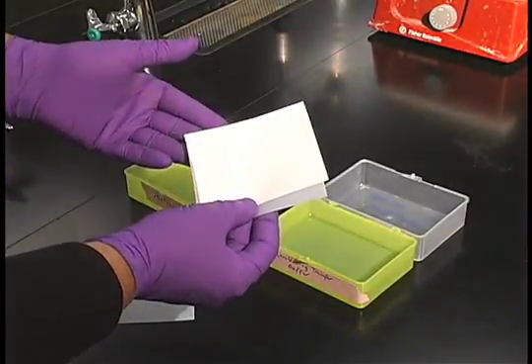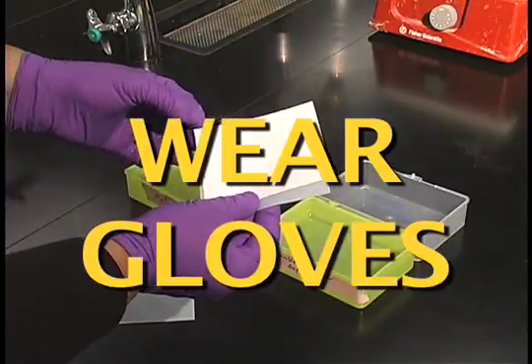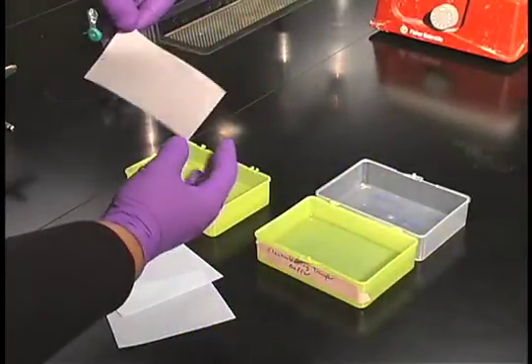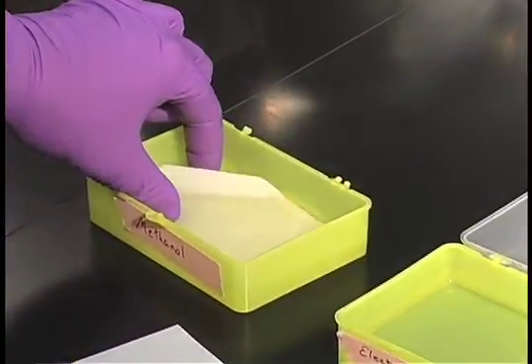You have to pre-wet the PVDF paper in methanol. All you have to do is just get it wet.